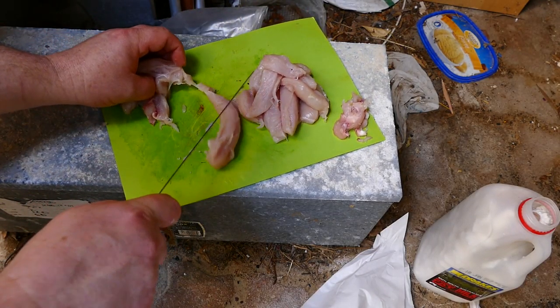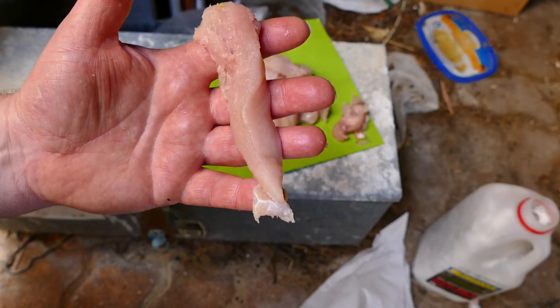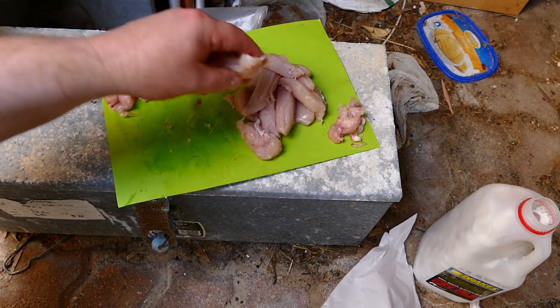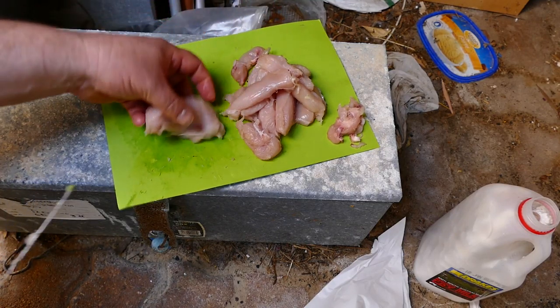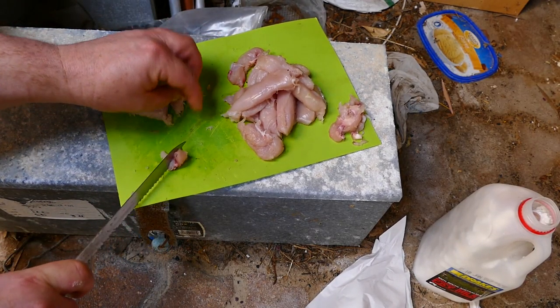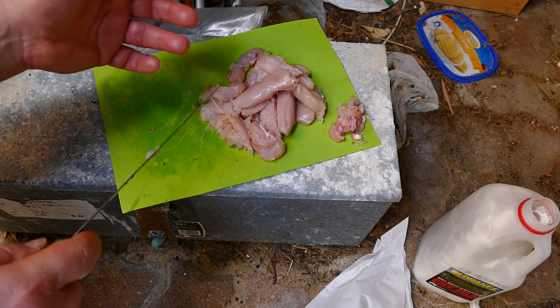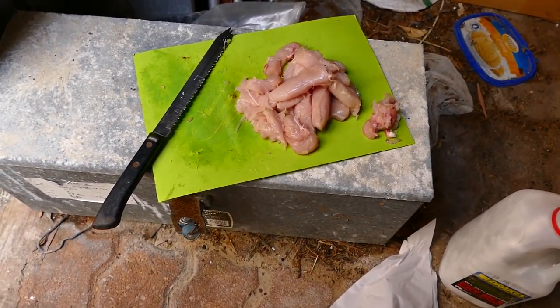Don't waste anything. This is like a really big fat slug. That's probably a snail-sized piece — we want to get rid of the red bit on the side though. We're using chicken breast because it's iron-deficient — white meats are iron-deficient compared to red meats. It could be that the organism doesn't like iron, or the plants don't like iron because they can't control the organism. We don't know, but anyway, that's done.